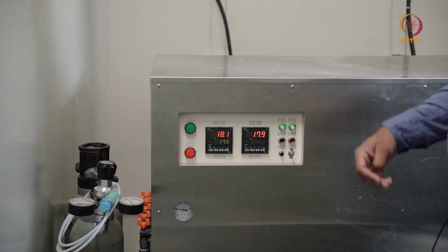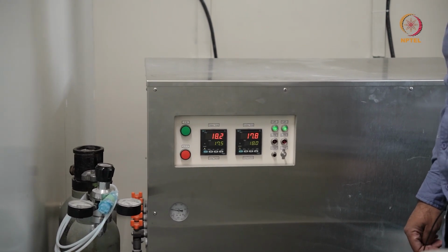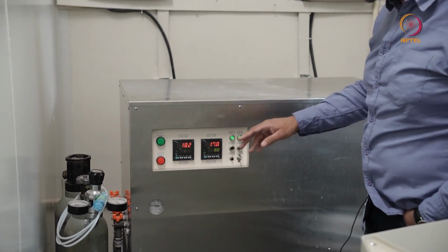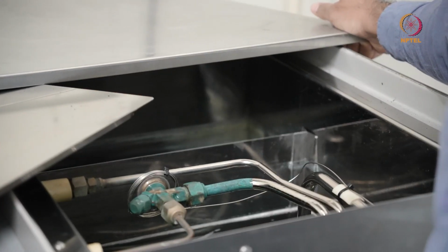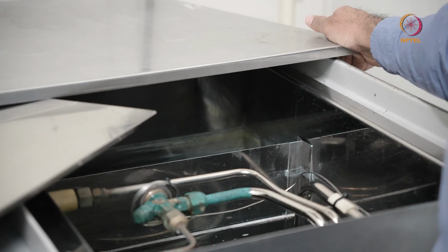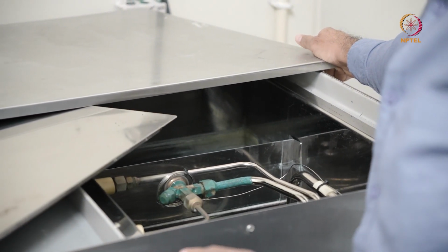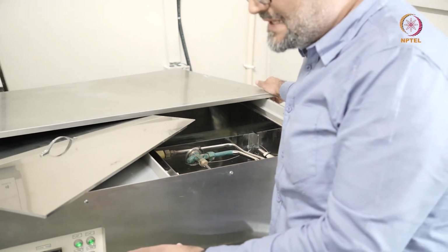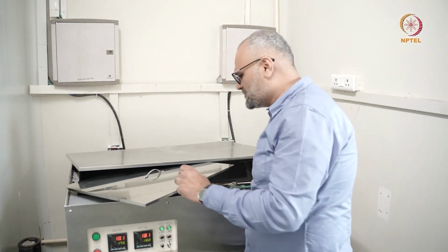It just gives you the temperature of the water that is being circulated in the microscope column. Remember, when you're using electromagnetic lenses, they often get heated up, and to maintain the lens uniform at a given temperature, you're circulating chilled water. If you come in closer, so here's the chilled water that is being pumped in. It is typically deionized water, and as long as this is circulating, you do not have an issue with the chiller. Sometimes it so happens that you have an error on the chiller, and this could be one of the reasons why your microscope stops.